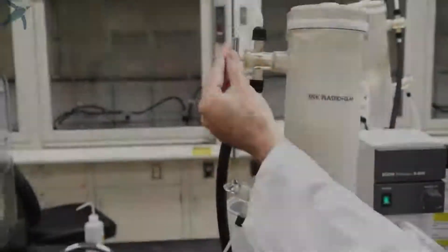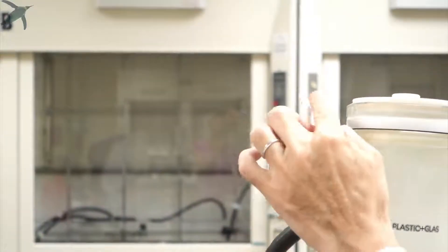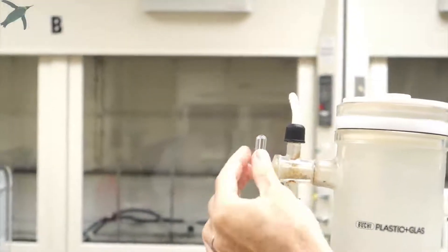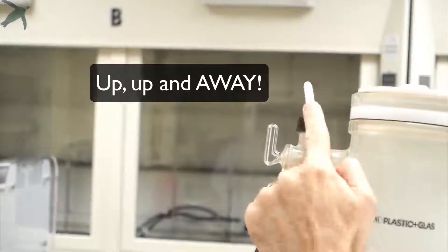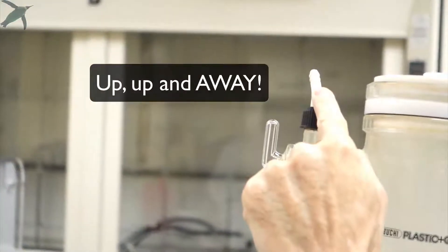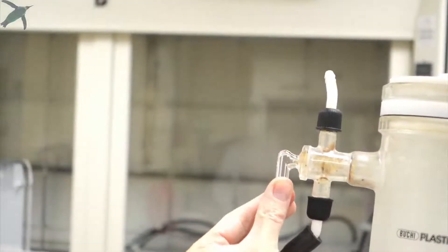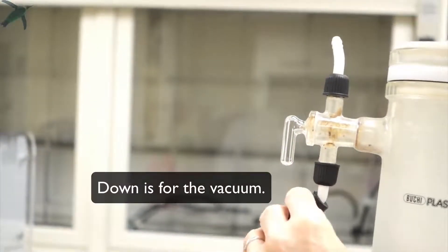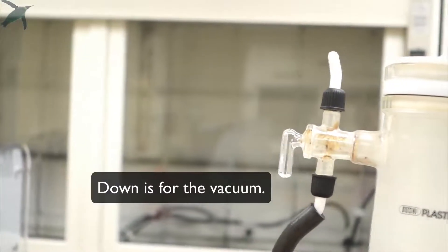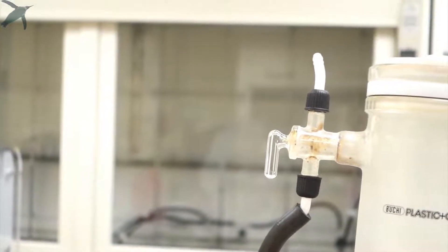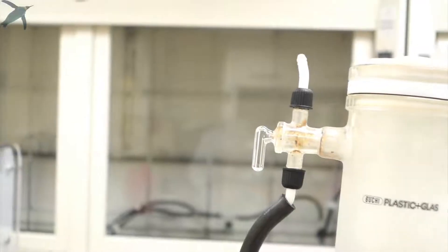and the vacuum vent valve. The valve opens the whole system to the atmosphere when it is pointing up. There is an open valve here that connects to the atmosphere. When you point the valve down, the whole system is connected through this vacuum tube to the vacuum pump, so the whole system is under vacuum.